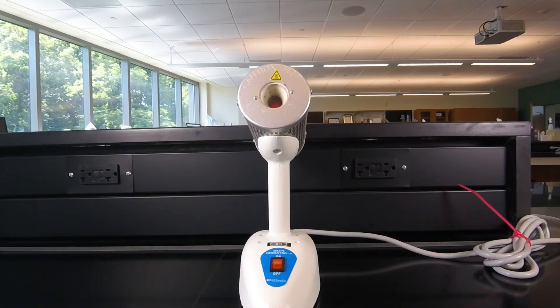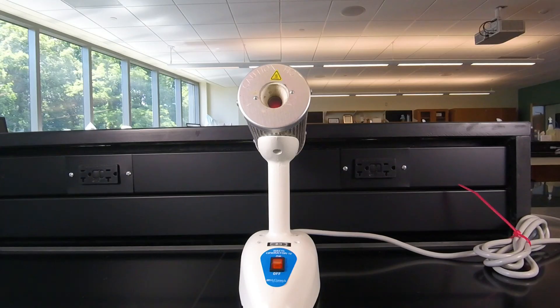At that point, the bacteria should be stuck to the slide. We're now ready for the actual staining procedure, which we'll learn in another video lesson. Thank you.